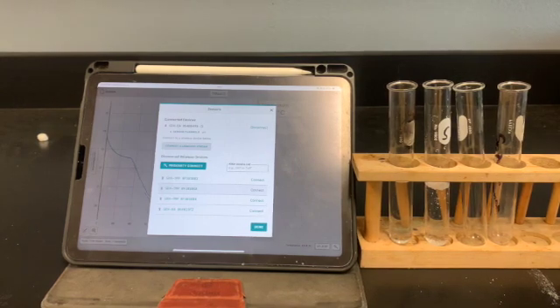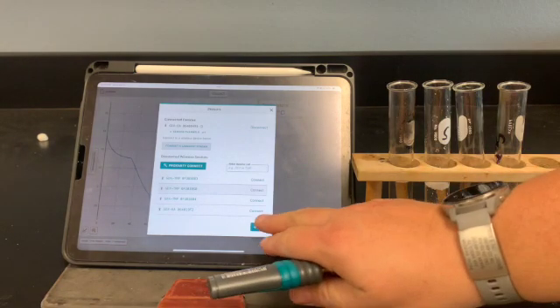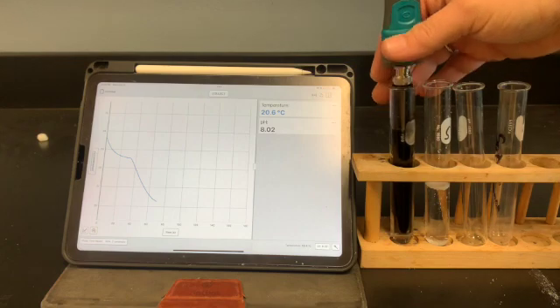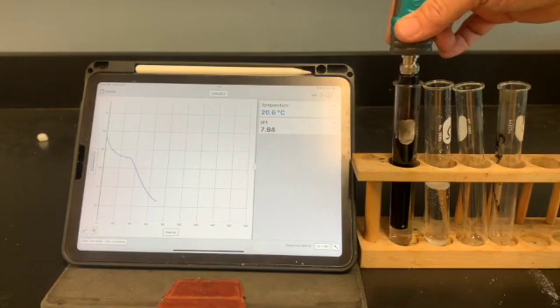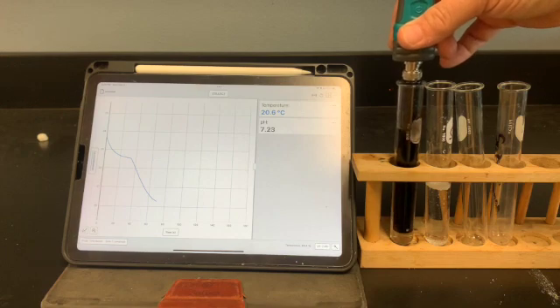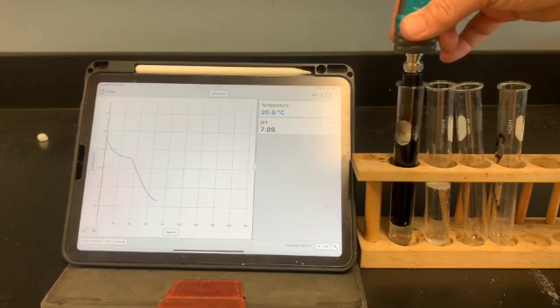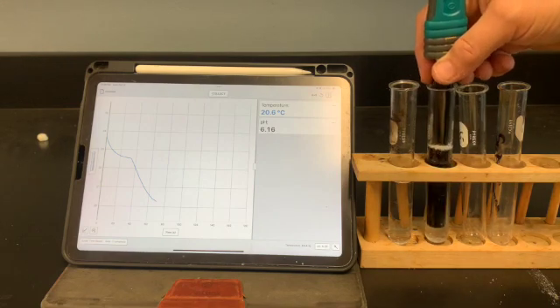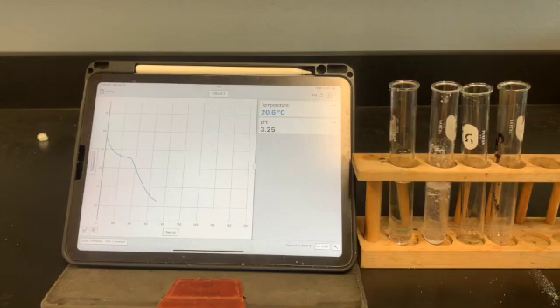So one of the last tests, besides the hydrochloric acid or the sodium hydroxide, is a pH test. And so I'm going to use my pH probe. I've got it connected. I'm going to say done. Again, I just need to know what my reading is. And I'm going to stick it in there, and I'm going to record what it has for pH. Okay? And then I'm also going to verify it with universal indicator. So I'm going to get a pH reading for all of these, and see, that one's different.